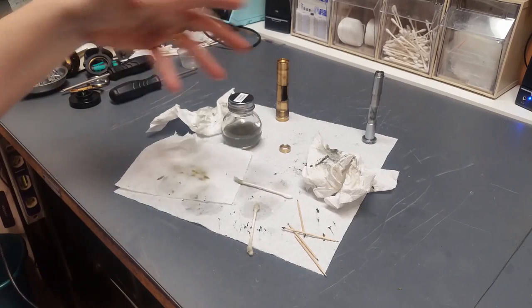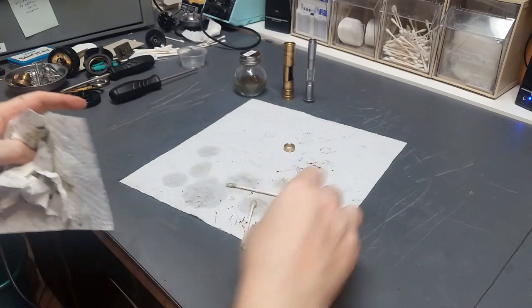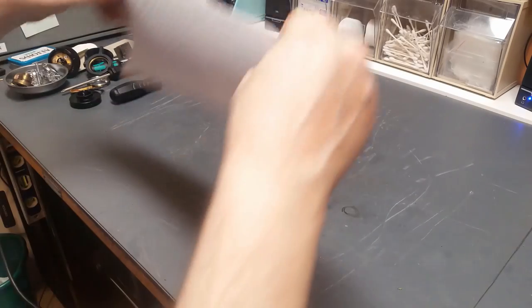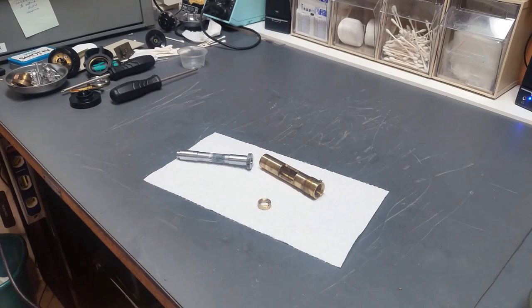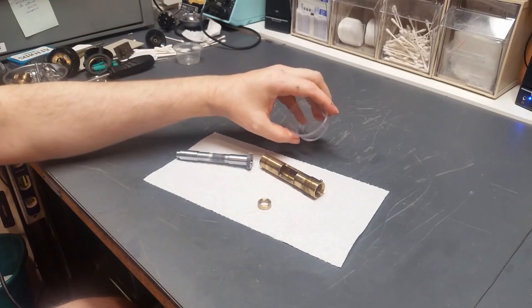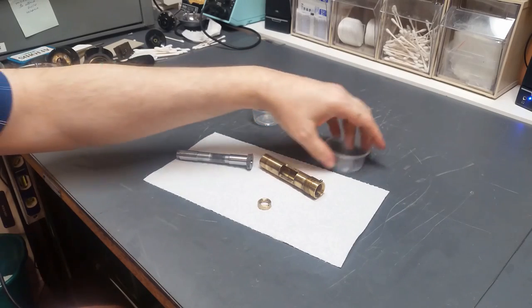Okay, I spent a good 20 minutes cleaning up these pieces. You can see some of the aftermath here. So let me get rid of this. Okay, so these are the pieces here. So now I need to clean up the ball bearings, and then we'll be ready to put this together. Okay, I've got the balls cleaned up. 30 bearing balls in here, 30 in here, that way I don't have to worry about counting them when I put them in. I just put this on one end, this on the other, and it's done.